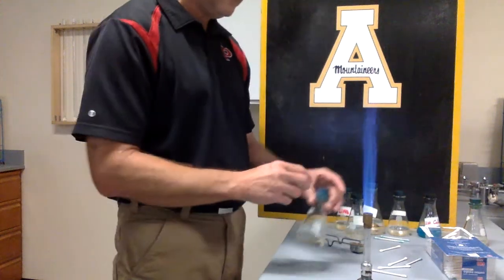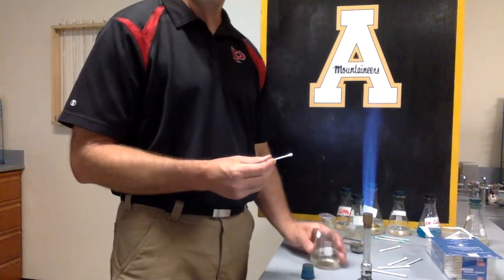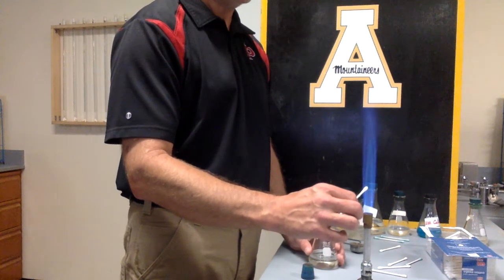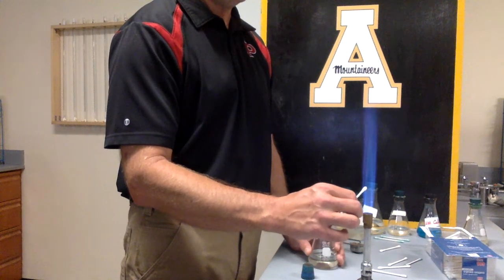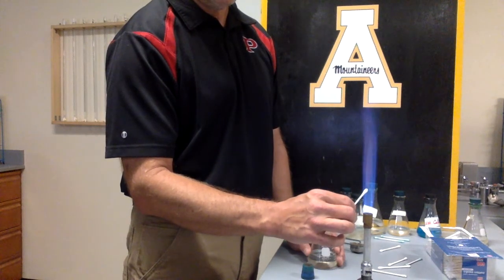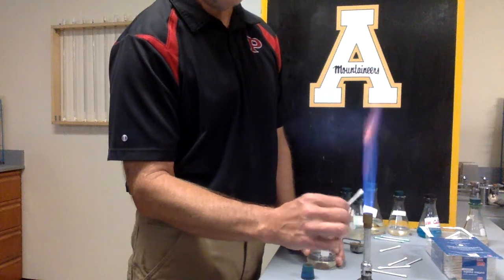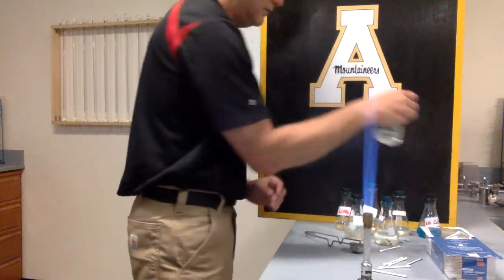All right, I'm going to give you a potassium nitrate. Notice it doesn't matter what the solution, it's the metal that we're actually looking at. So all potassiums are going to be this color, and this color is, ooh, let's wait just a second. I don't know if y'all can see that one yet. Here it comes. Yeah, it's got a lavender, kind of a purplish color to it. All right, so that one has a little bit of a lavender or a purple color to it.